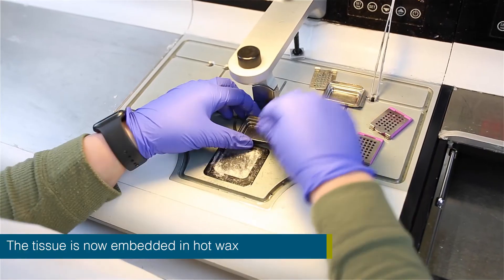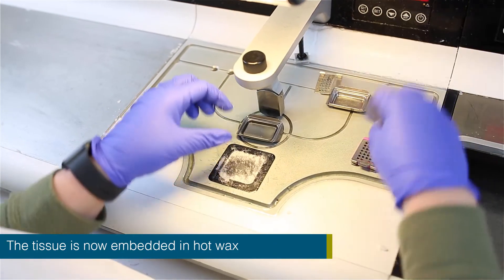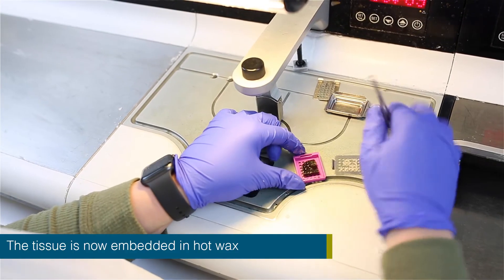Once the tissue is processed, the tissue will be ready to be embedded, cut and stained.